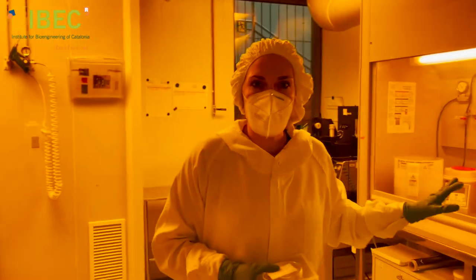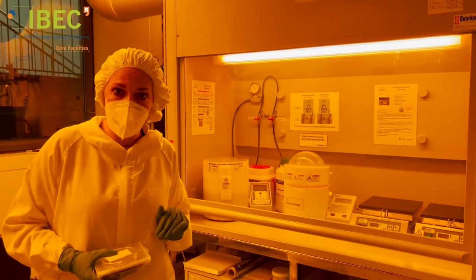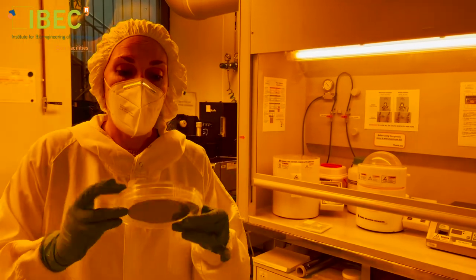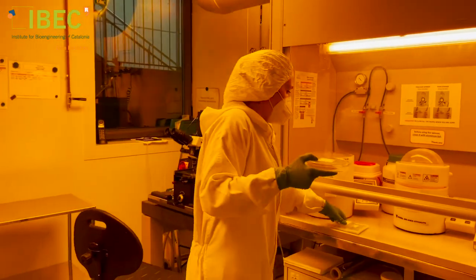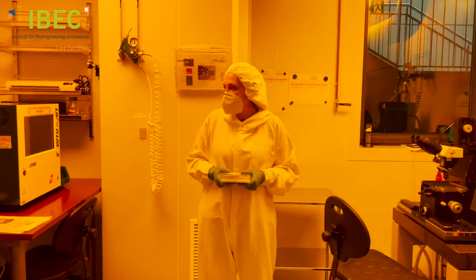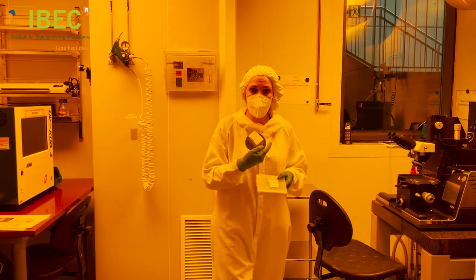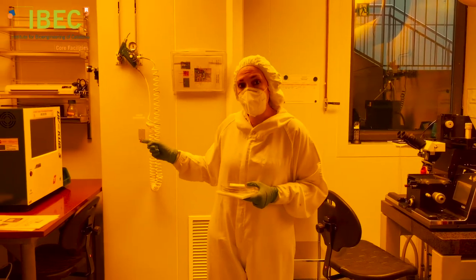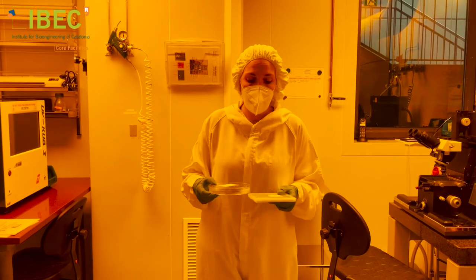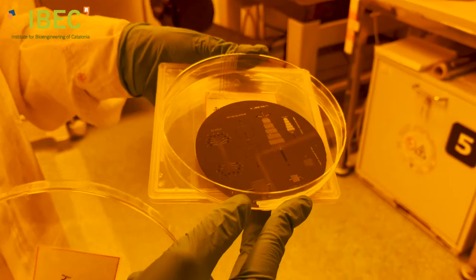We have accessory equipment like hot plates and spin coaters. Spin coaters are used to deposit thin and uniform layers of photoresist. Once we have deposited a uniform layer of photoresist on a substrate — for instance, this silicon wafer — we place the substrate and the mask together in these machines, which are mask aligners. In this case, a UV lamp shines on the mask and transfers the pattern to the final substrate, and here you can see the same pattern as before transferred onto a substrate.